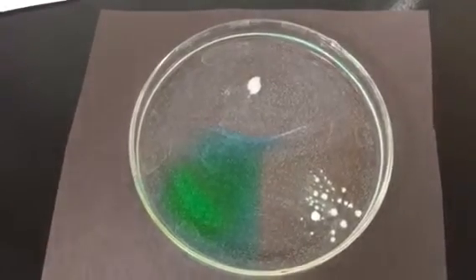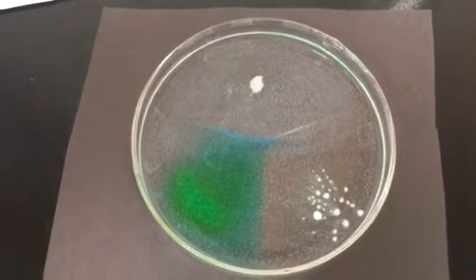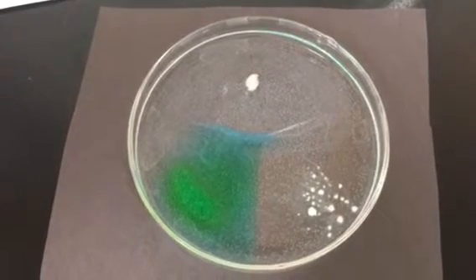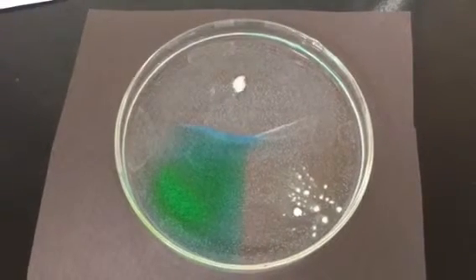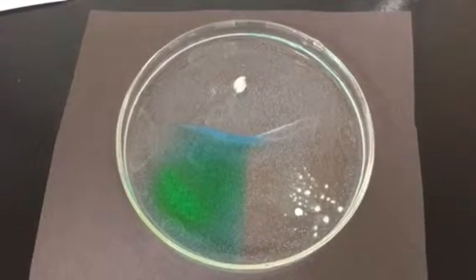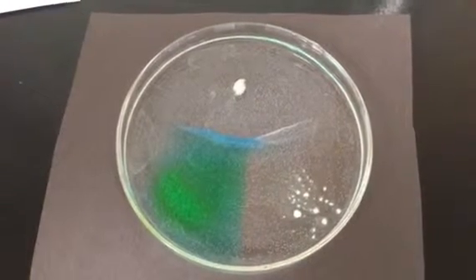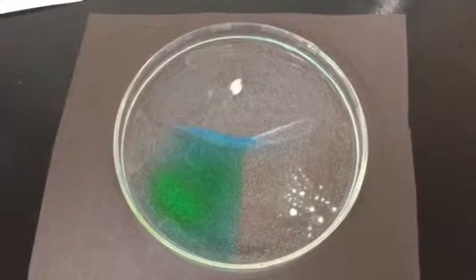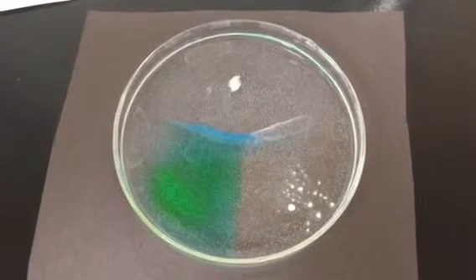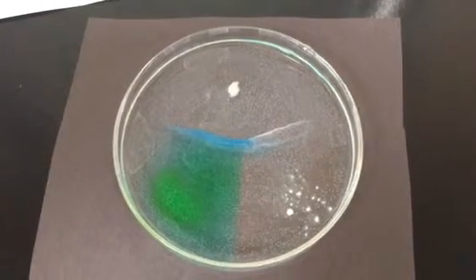We're going to have to think about that. Think about the colors that you're seeing, because you see a line forming, but is it the same color all along? Copper salts tend to be blue or green, whereas most salts, especially salts of things like calcium and sodium, are going to be colorless or white.